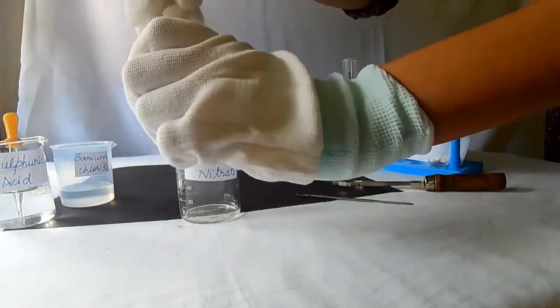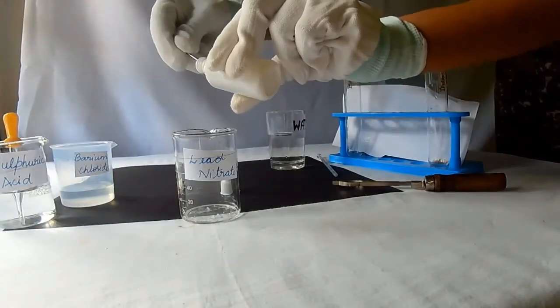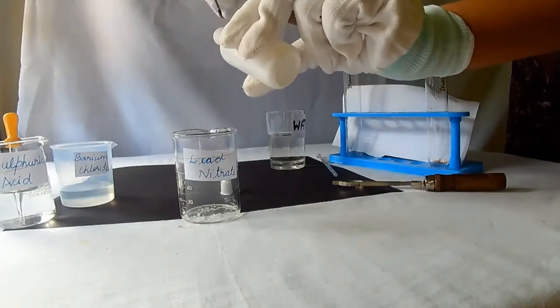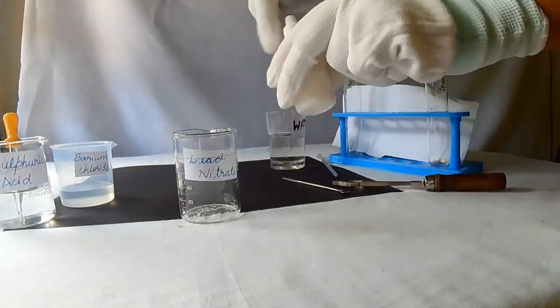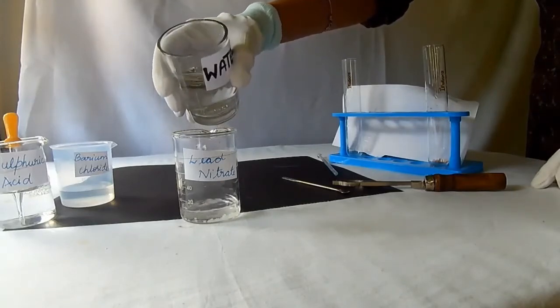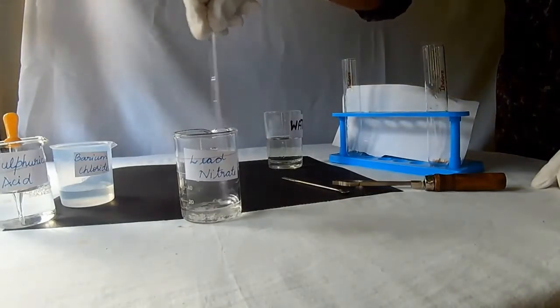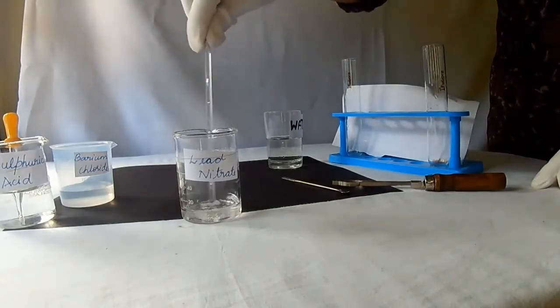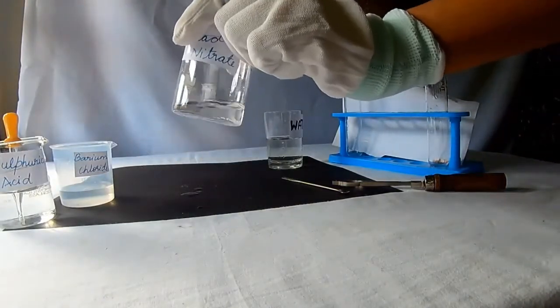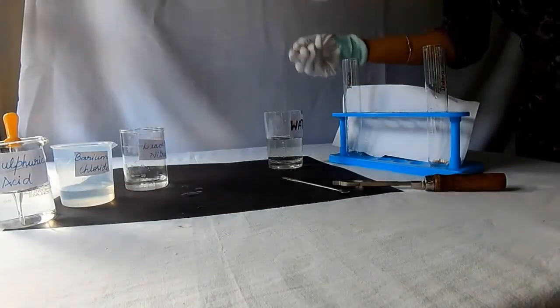Now prepare the solution of lead nitrate salt. First, add a little salt to the beaker. Add water to prepare the solution. Mix it well so that the salt dissolves in water. Be careful while performing the experiment. Now the solution of lead nitrate salt is ready.